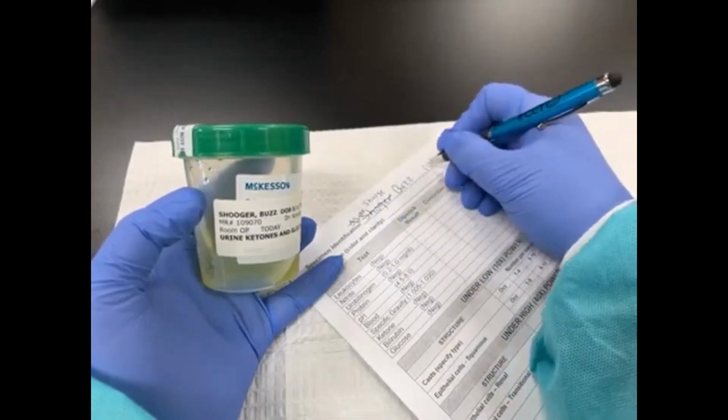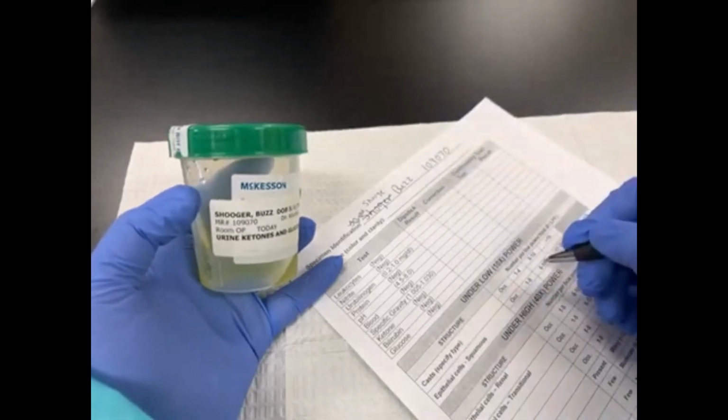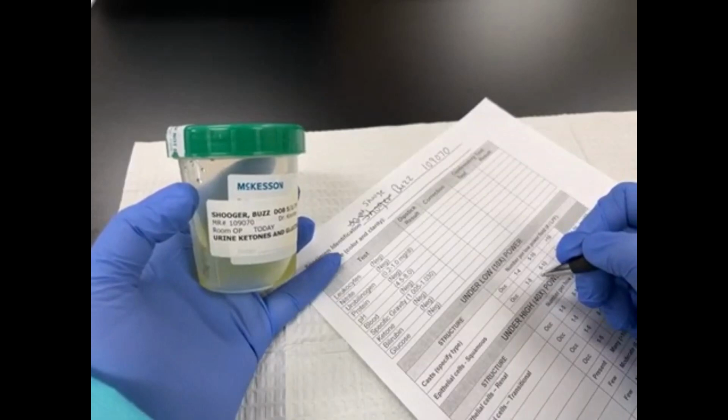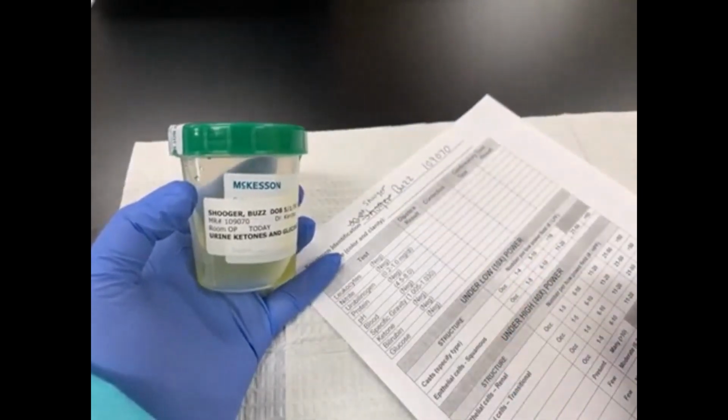If one of these numbers was wrong, you cannot do a write over. I can't change a 0 to an 8 or a 9 to a 7. That's called a write over. That will not be acceptable. Incorrect corrections will have points taken off.